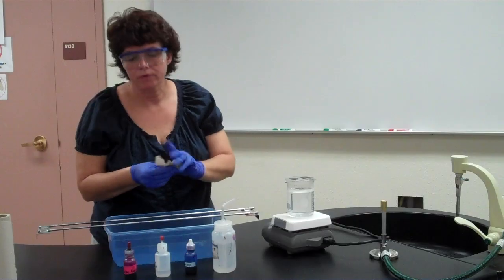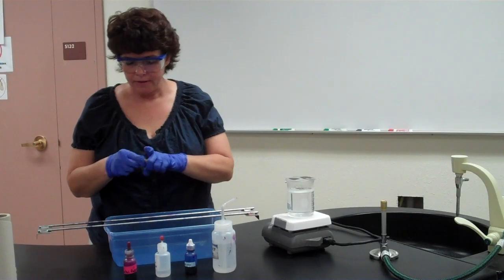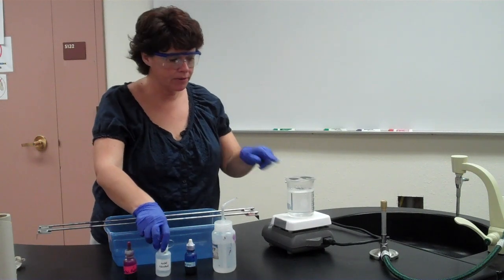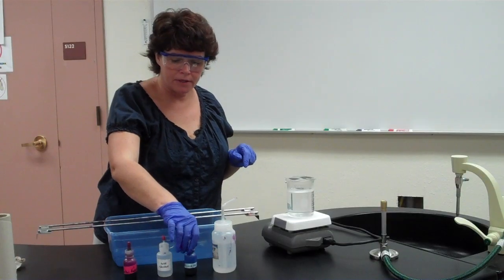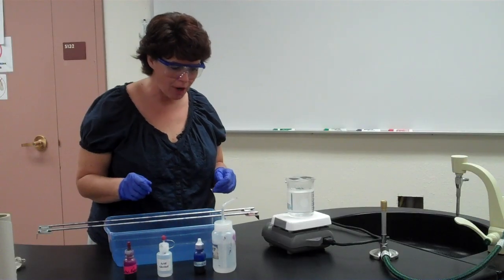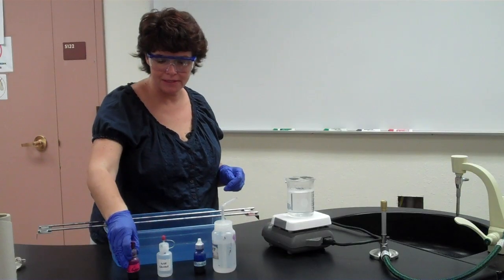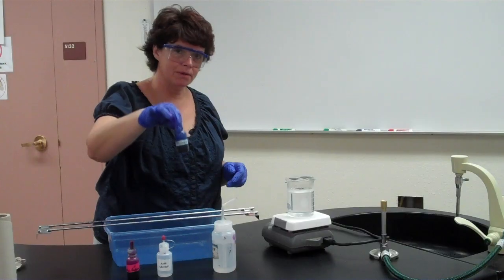If you remember with the gram stain, we used ethyl alcohol, okay? This time we're using acid alcohol because we want to see if the bacteria retain their primary color when washed with acid. The counterstain in this case is going to be methylene blue. So if a bacteria is acid-fast positive, it will be red at the end of the acid-fast stain. If it is non-acid-fast or negative, it will be blue.